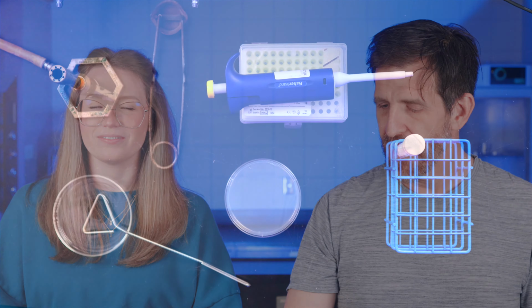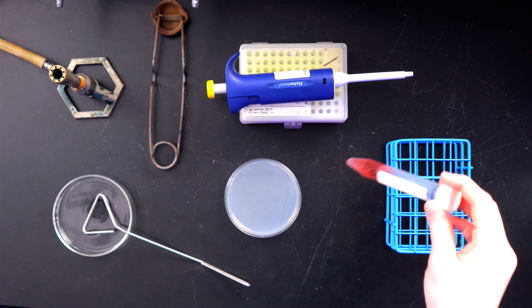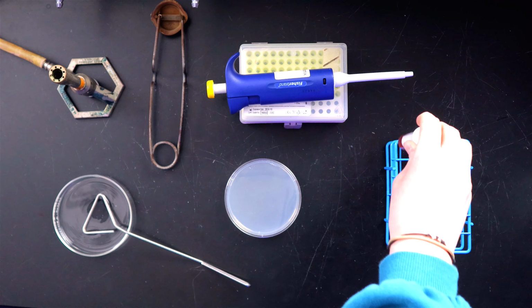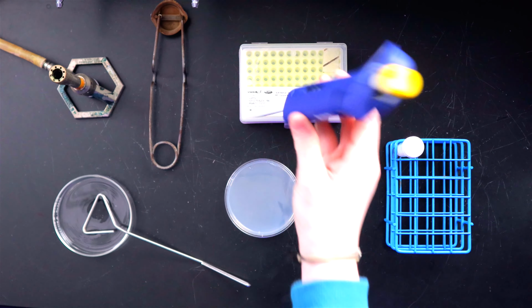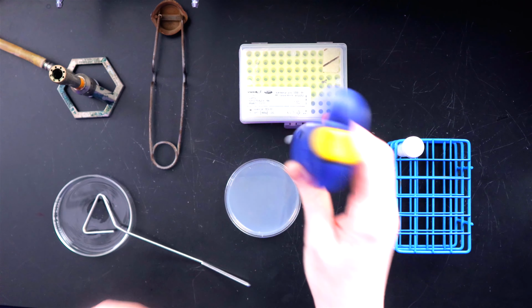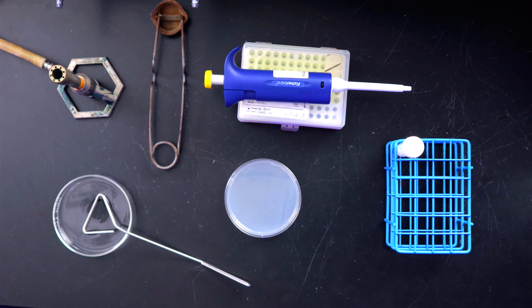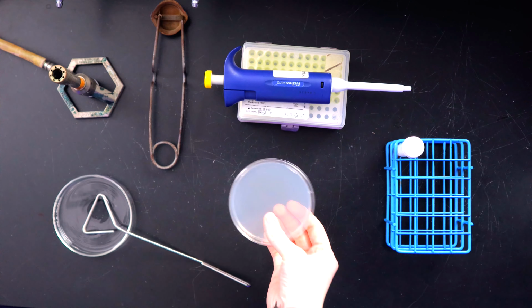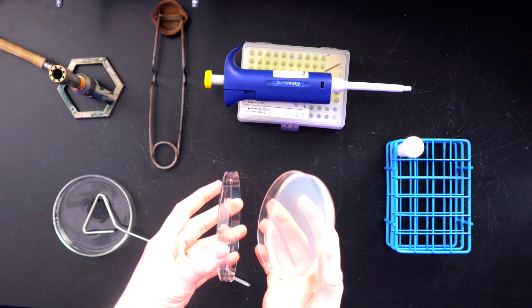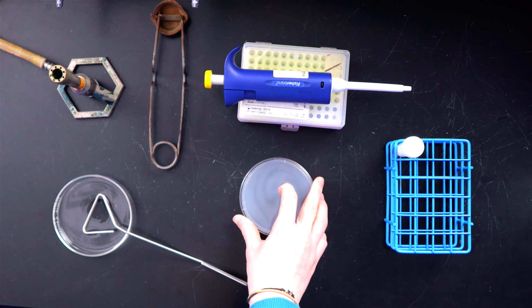Okay, so this is all the equipment you're going to need for this inoculation technique. Can you talk to us about some of these things? Yeah, so we have our sample here, and then we have our micropipetter. This is a 200 microliter pipetter, and it is set at 100 microliters. Just be sure to always check with your TA to ensure that you have the right micropipetter set at the right measurements. Here we have our plate of media, which is that jelly-like substance that we place on the bottom, so we can easily take off the lid and place it back on.